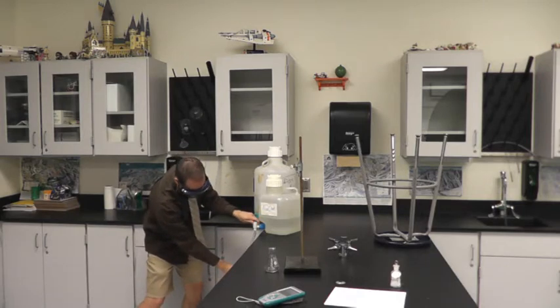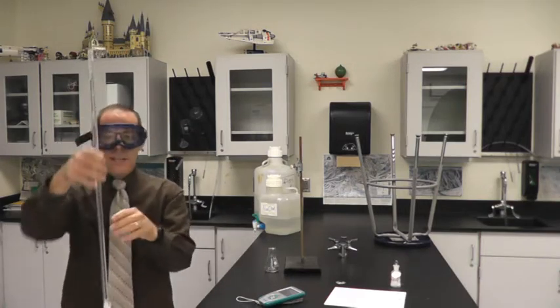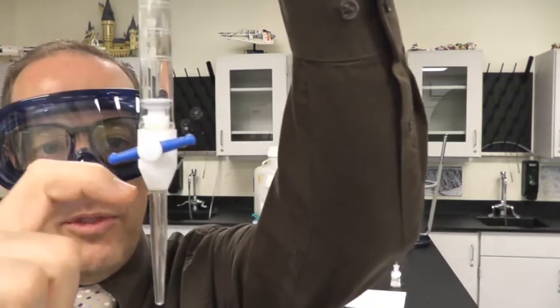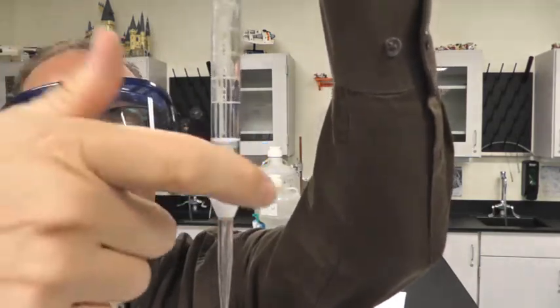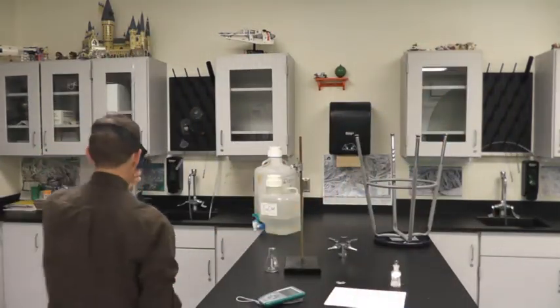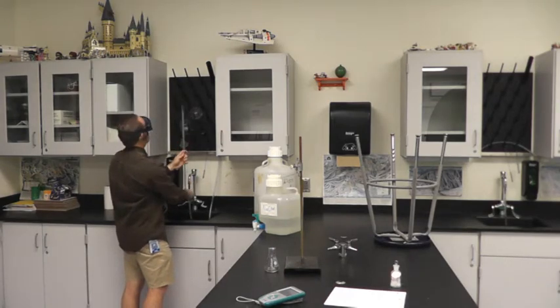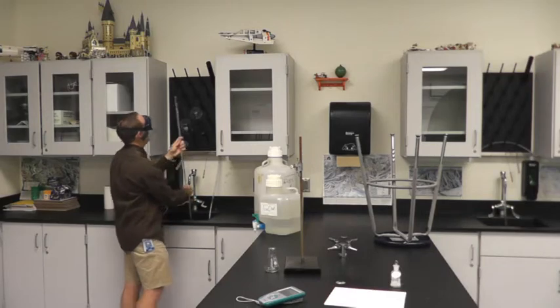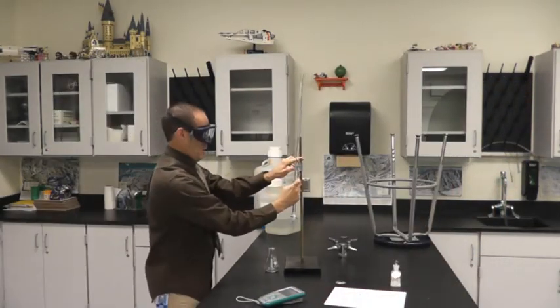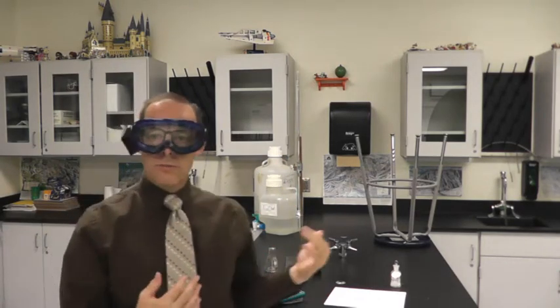Then we're going to fill it again. And actually what I did is I filled it past the little zero line at the top. And what I'm going to end up doing, I can't really show you this, but this tip has air in it right now. So I'm going to open the stopcock and let the air get pushed out by the liquid. So this is full of NaOH as well. So I'm going to come back to the sink. And then just make sure that my top line is below my zero mark. So you should see something kind of like that. And then you would, and this is data I'm giving you, you would then mark your initial volume of sodium hydroxide, which the data already has for you.